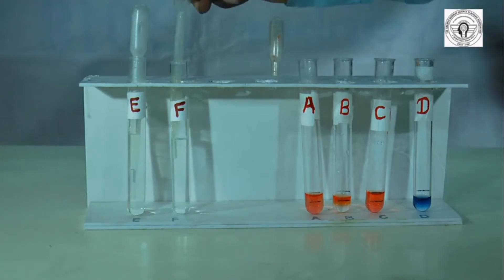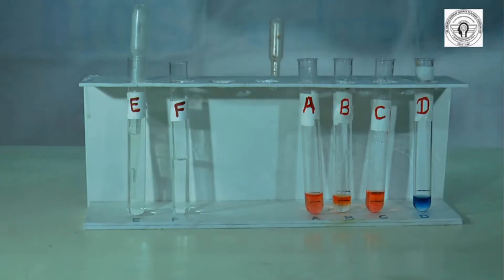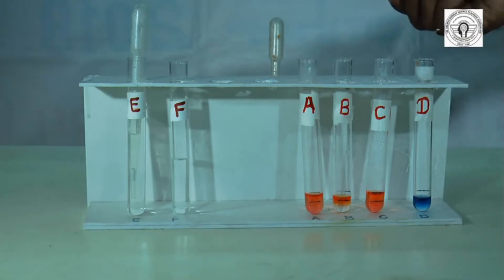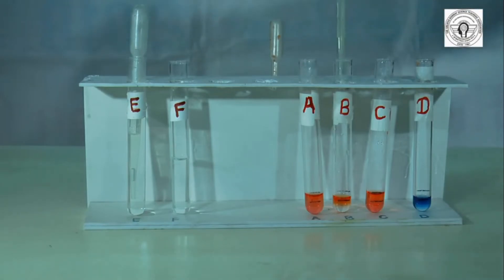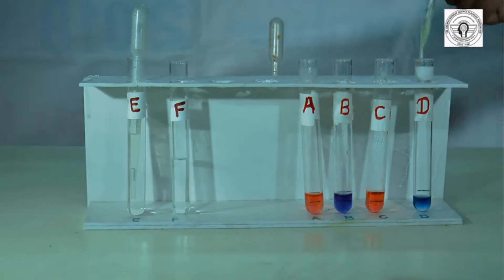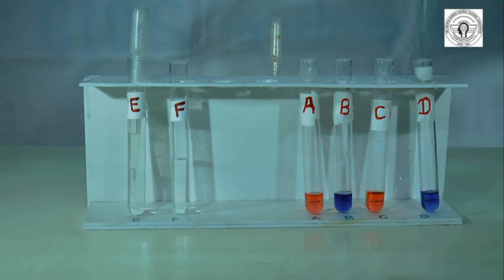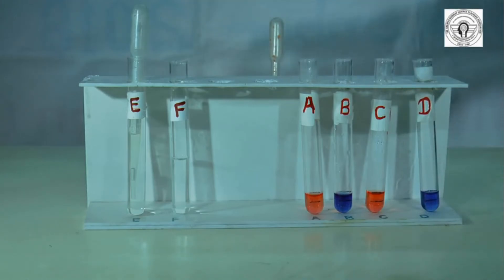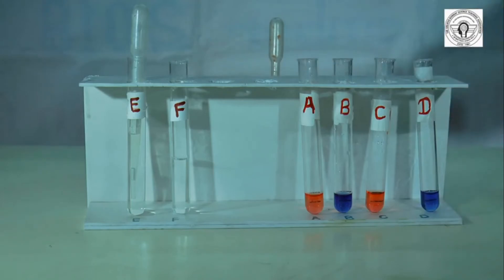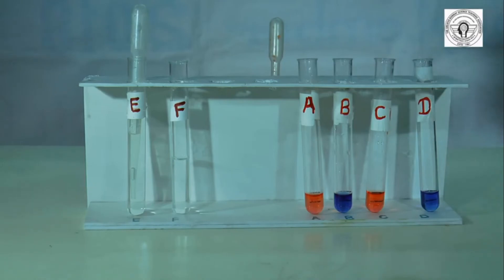From test tubes E and F, take another solution and add it into test tube B till the second mark, and into test tube D till the second mark. Observe the colors in A, B, C, and D and write all observations in the given observation table.